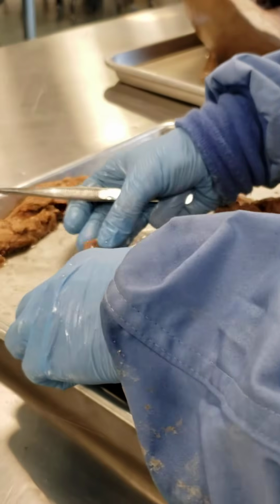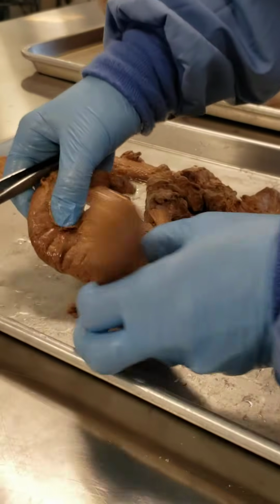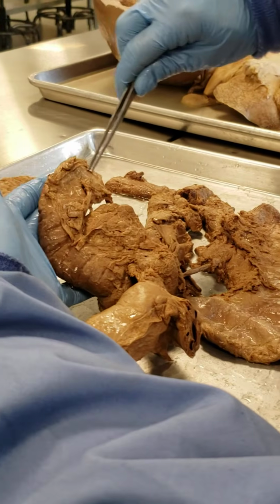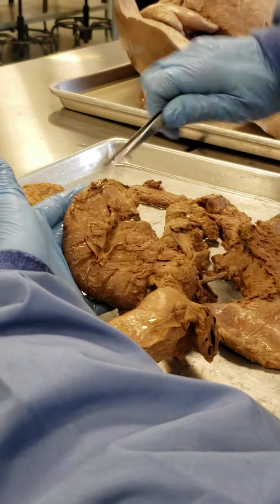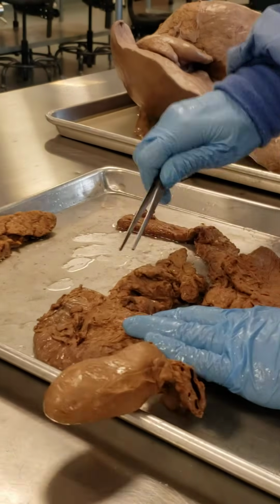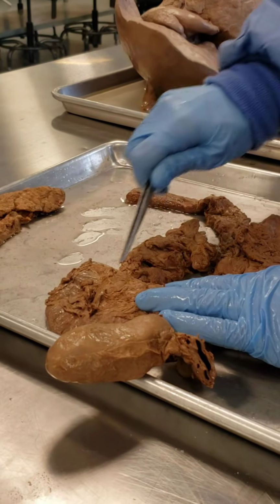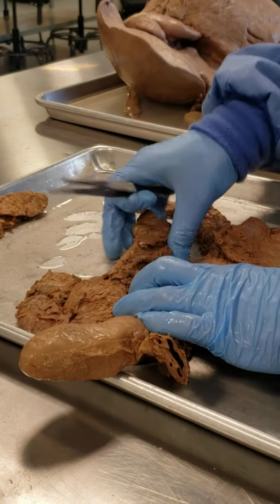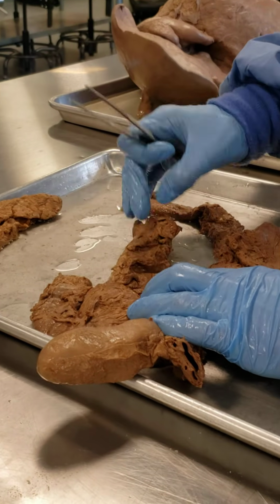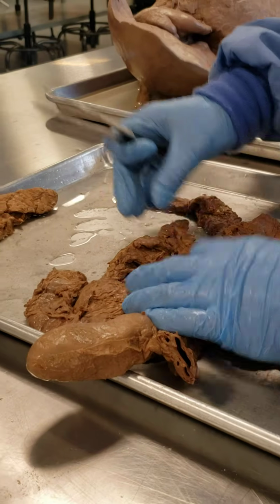And this is the first part of the small intestine. Here is my duodenum, okay? And we have that nice curvature of the duodenum, and here is the pancreas, all right? So again, this globular-like tissue, glandular tissue, is our pancreas.